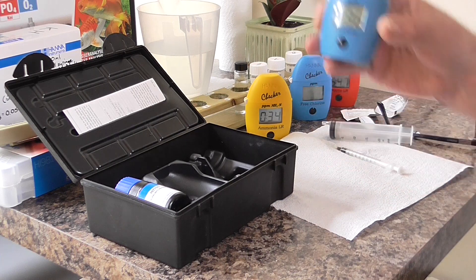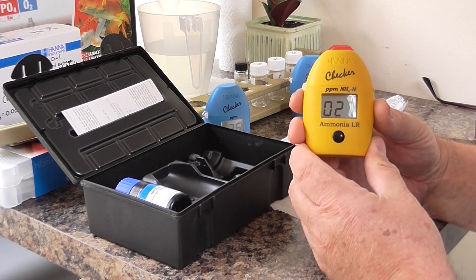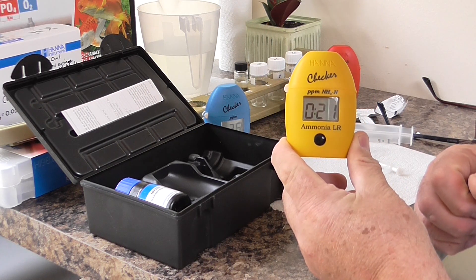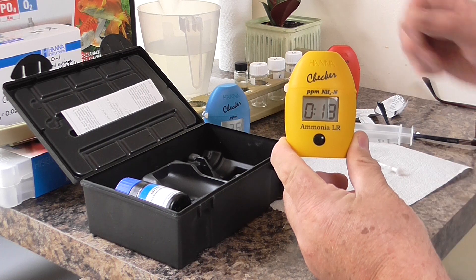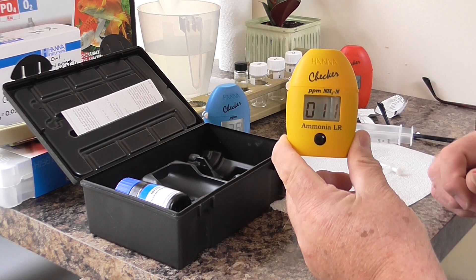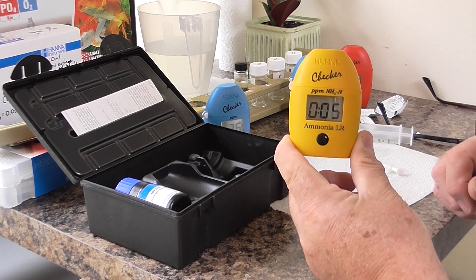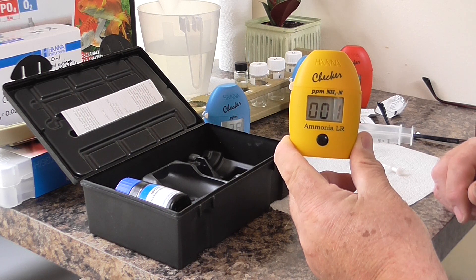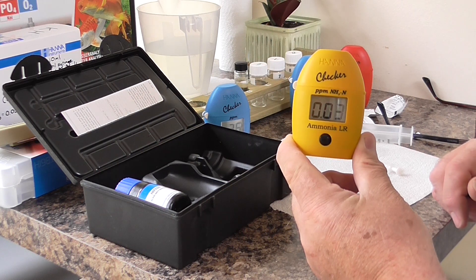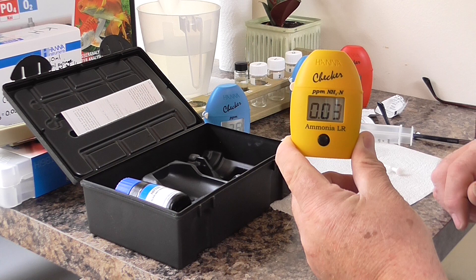I'll tell you what that means in a minute. Here's the ammonia checker — that's counting down with 26 seconds left. Ready to give the result for ammonia: 10, 9, 8, 7, 6, 5, 4, 3, 2, 1. The result for ammonia is 0.03 parts per million, which is okay.